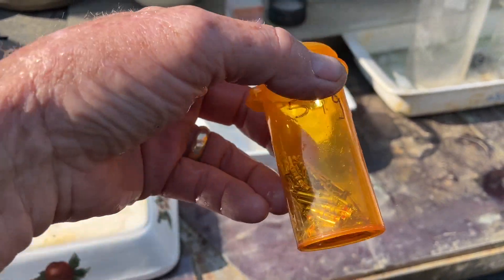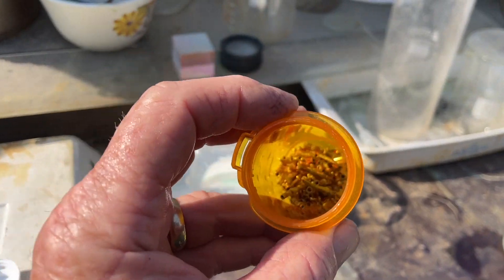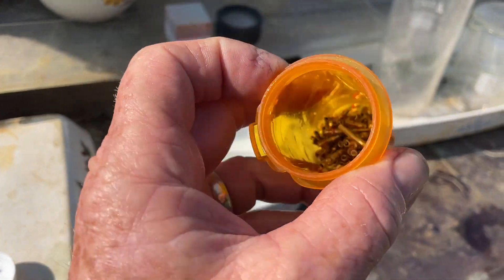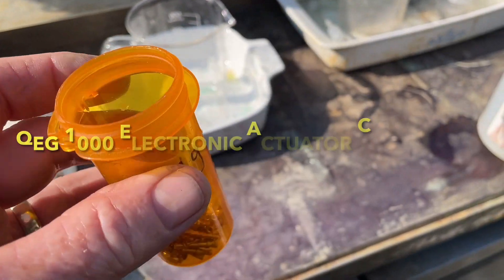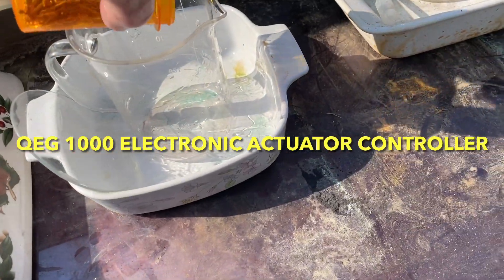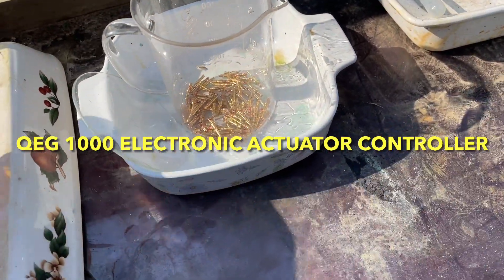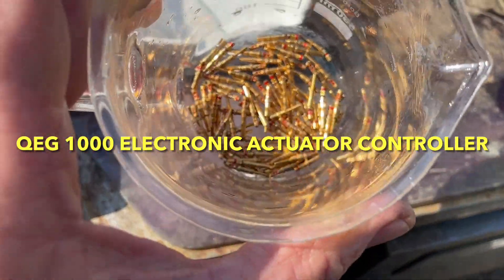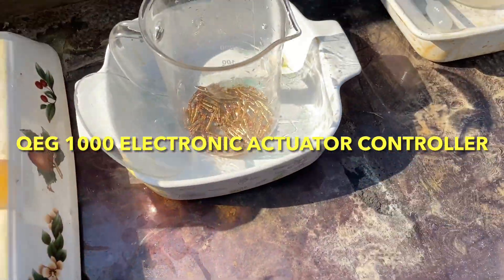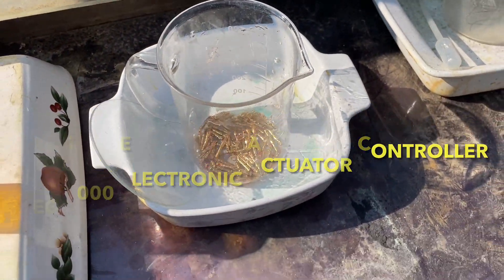So it's 54 grams of pins that I removed from that terrain gizmo the other day. I'll put them right in there. They have pretty heavy gold plating. I think they'll produce a tiny bit but we're gonna find out exactly how much they do.